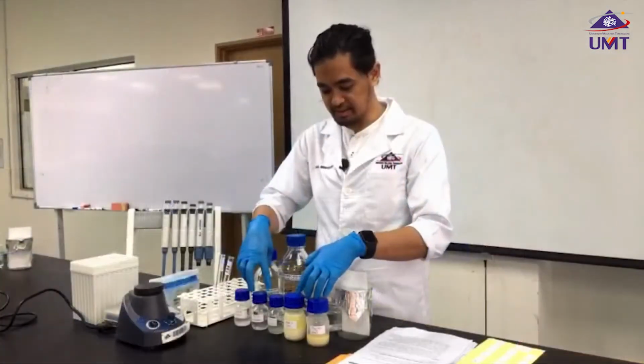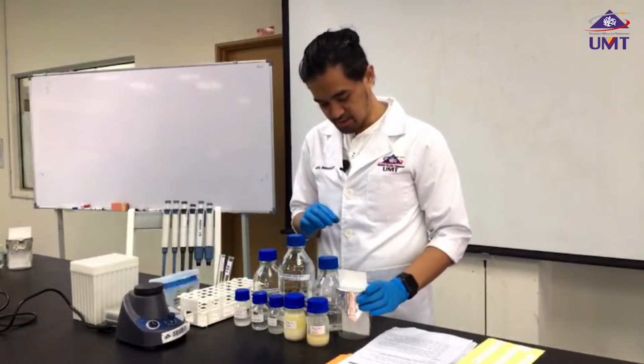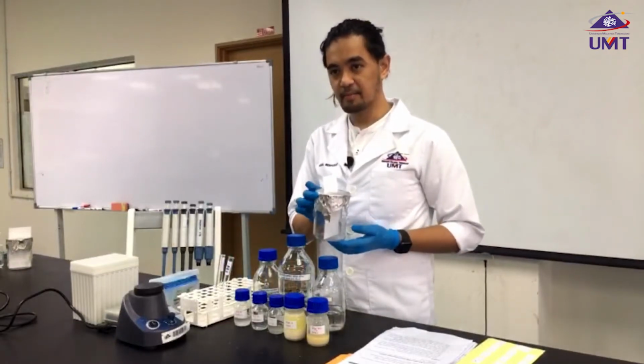Beside our 5 samples here, we also have our TLC plate.